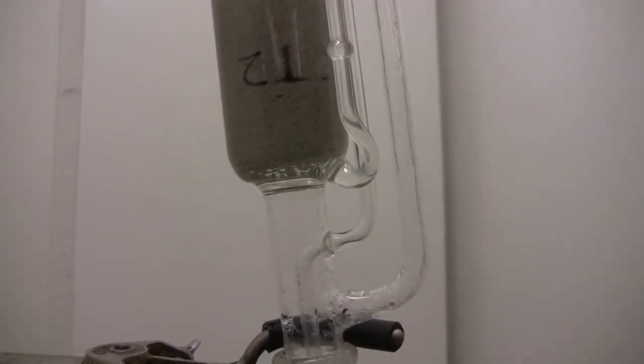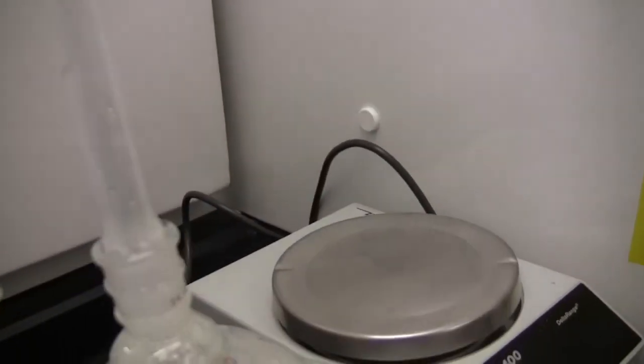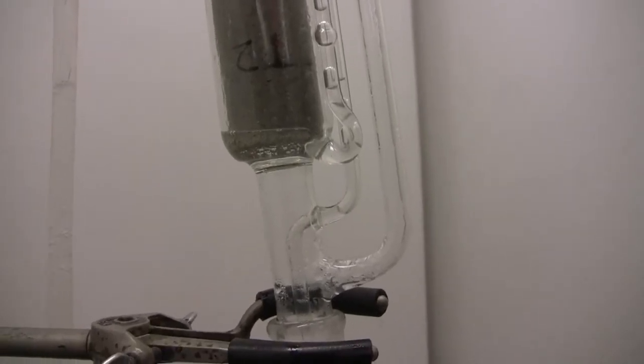So there are two mechanisms here. First mechanism is, okay, now you see the siphon effect. This is when all the fluids drip back into my graduated cylinder and then to the flask. So there are two mechanisms of work here: the temperature and dissolution. The temperature causes the water inside the core to evaporate, and the toluene that comes from the condenser, when it leaches or goes into the pores of my core, it dissolves the oil and causes the oil also to go out of the core by miscibility. So this is the idea of the saturation experiment.